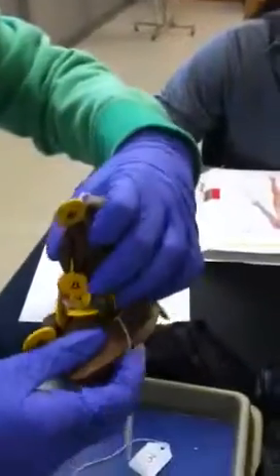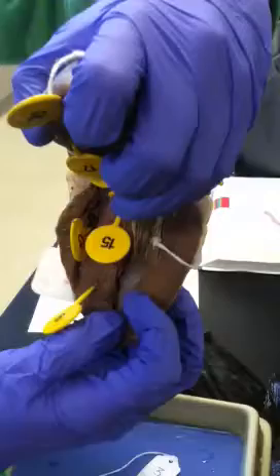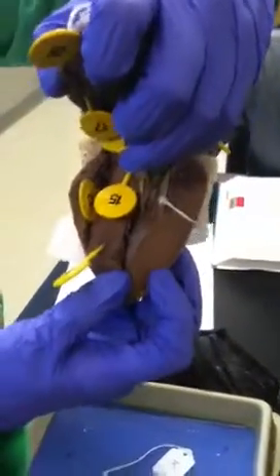The book says it has a role in valve function, and it projects into the ventricular cavity. What was number 10? Number 10 is papillary muscles. It has a role in valve function. It connects to the valve, and it projects into the ventricular cavity.